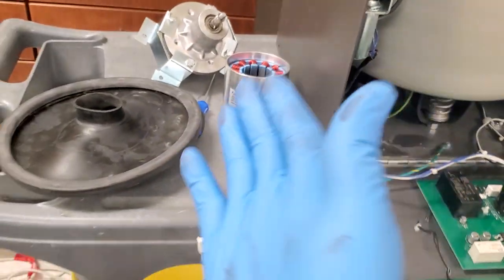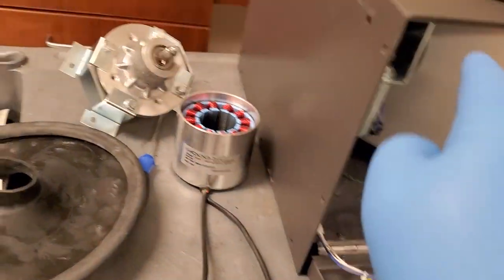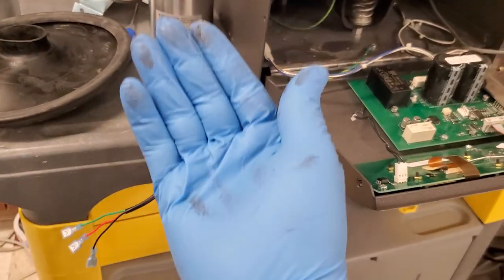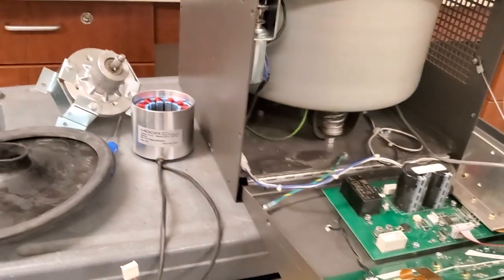Okay, so the failure is out of balance, no balance sensor, motor wear, bearing wear. Vibrations will create dust, and dust gets on everything. So, all right, guys, that's a little one for you. That's a centrifuge failure. If it happens to one, remember, it's probably happening to others. So check the other ones as well.